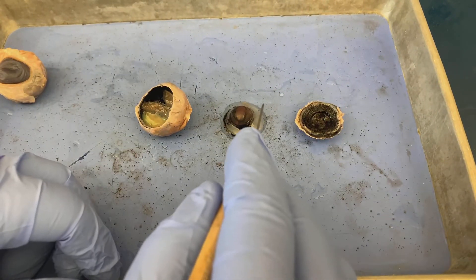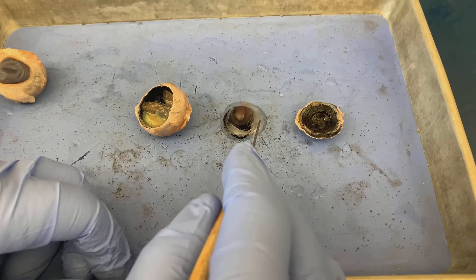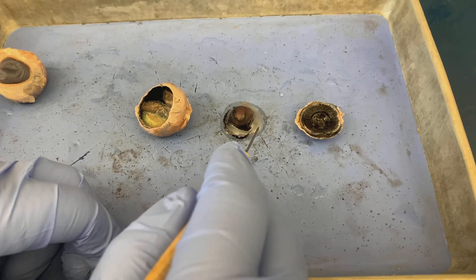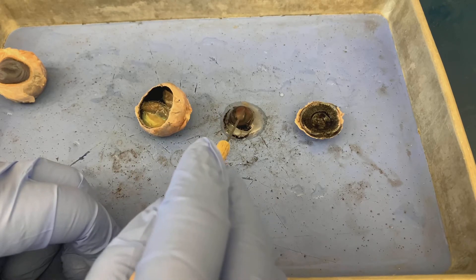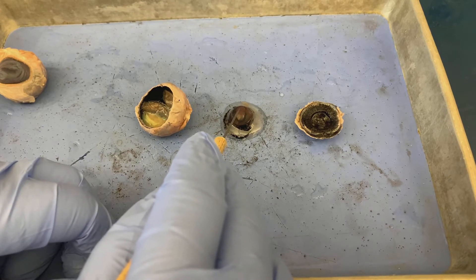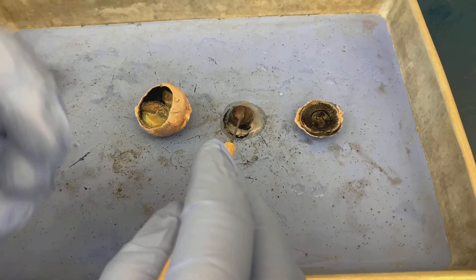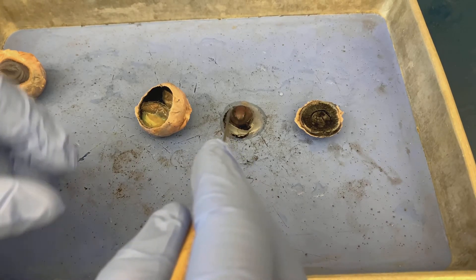What we have here, what looks like a really gross egg, is the gelatinous material that helps maintain the actual shape of the eye overall. This is the vitreous humor. And this hard, egg yolk-looking structure on the top is actually the lens. This is hardened and discolored because the sheep is dead.